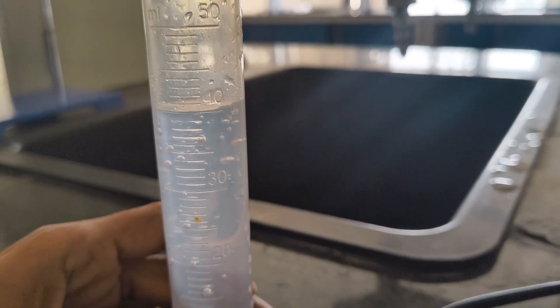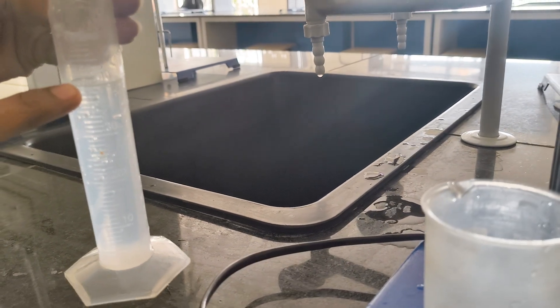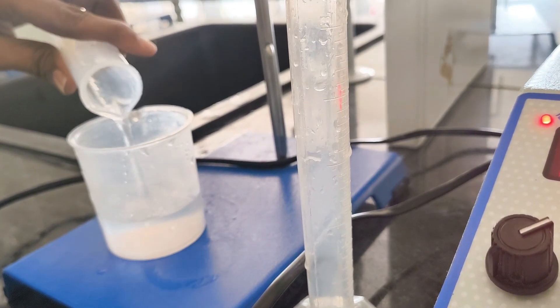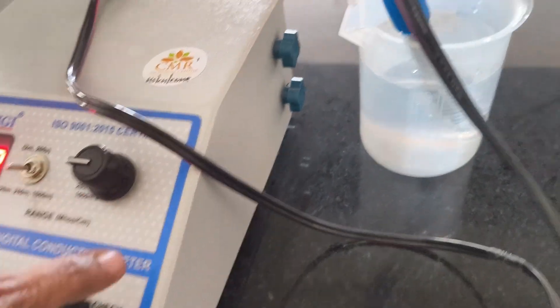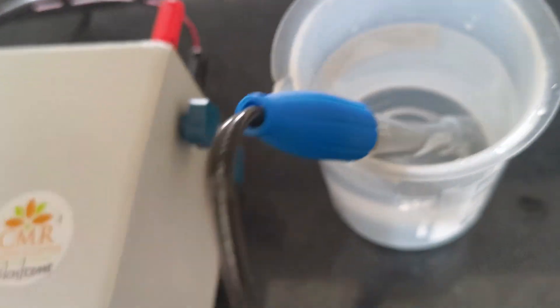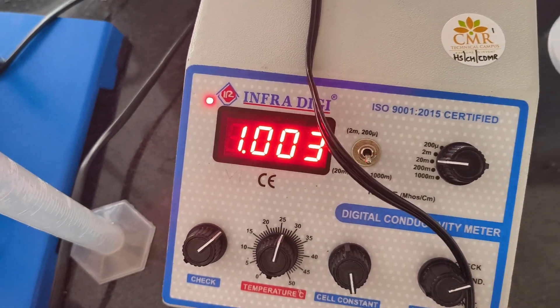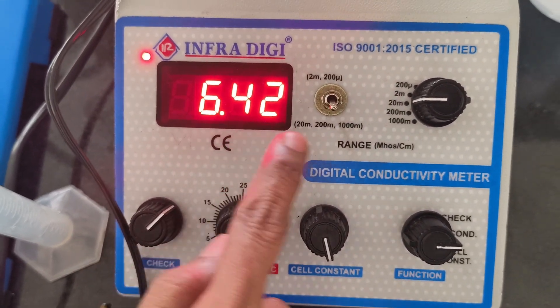This is the conductivity experiment: estimation of HCl by conductometry. We are taking 40 ml of HCl, measured using a measuring jar and transferred into a beaker. This is the digital conductivity meter connected to a conductivity cell. The conductivity cell, currently dipped in distilled water, must now be taken out and dipped into the HCl solution.